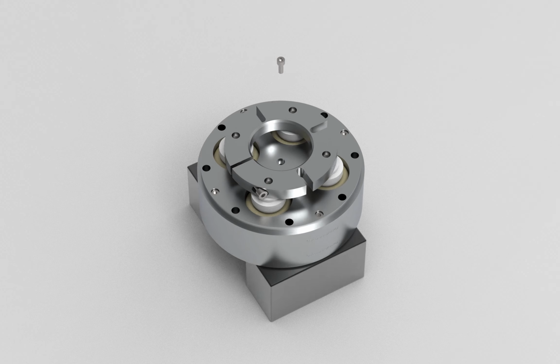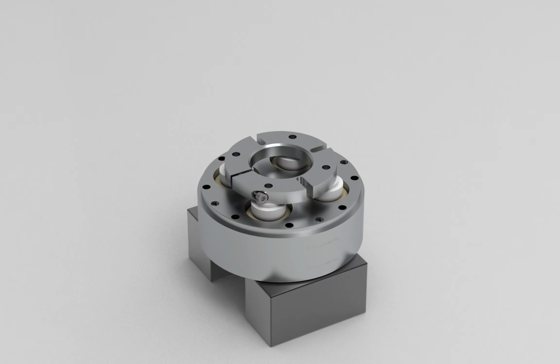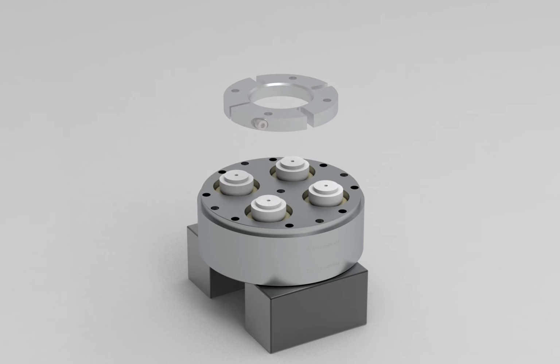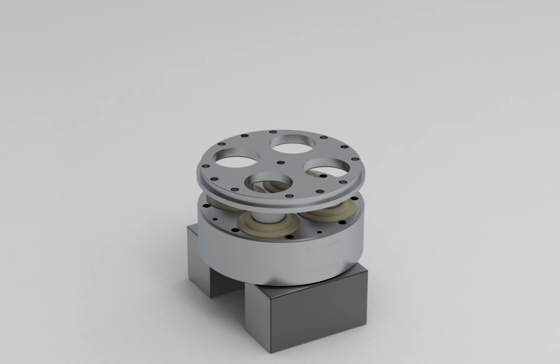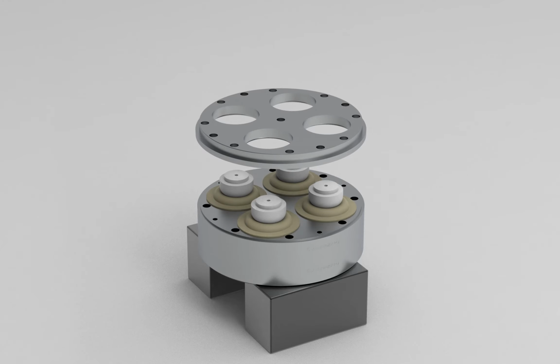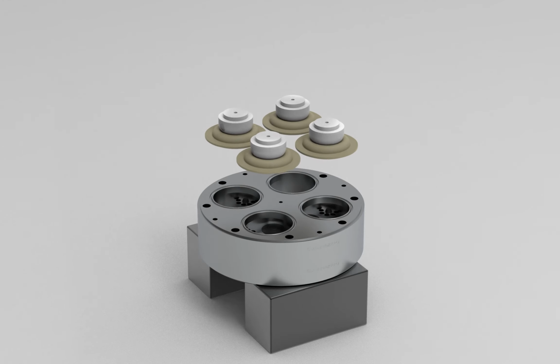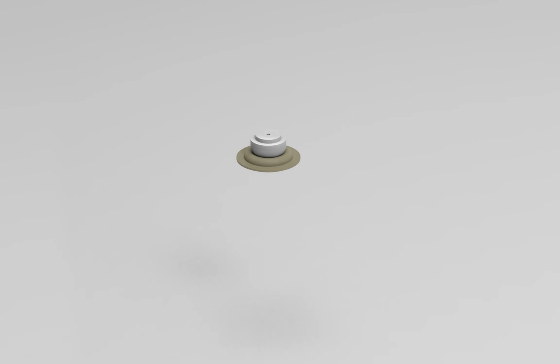Remove the center screw. Remove the screws. Remove the screws from the clamping ring. Remove the clamping ring. Remove the diaphragm housing cover. Remove the diaphragm together with the diaphragm support.